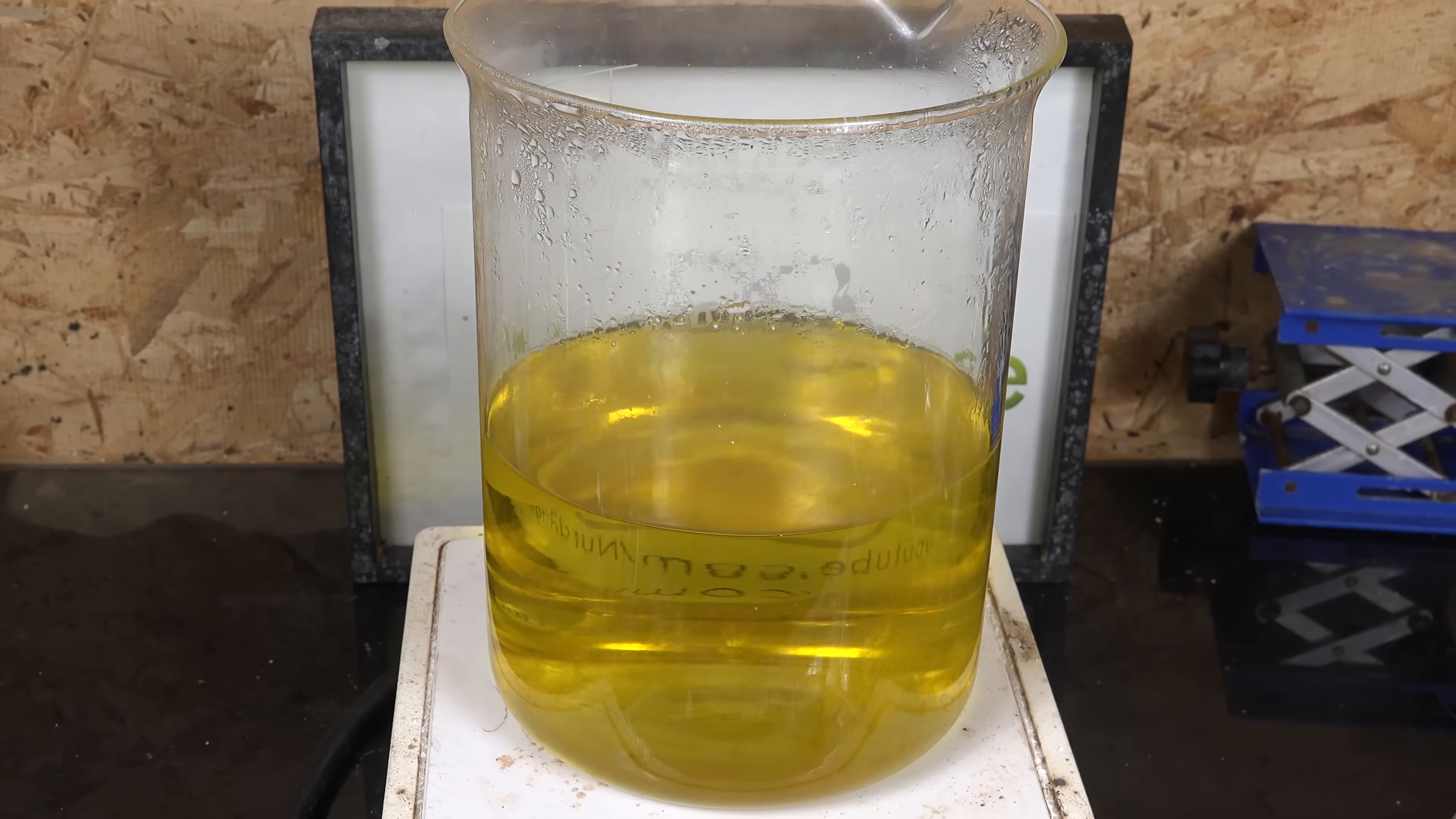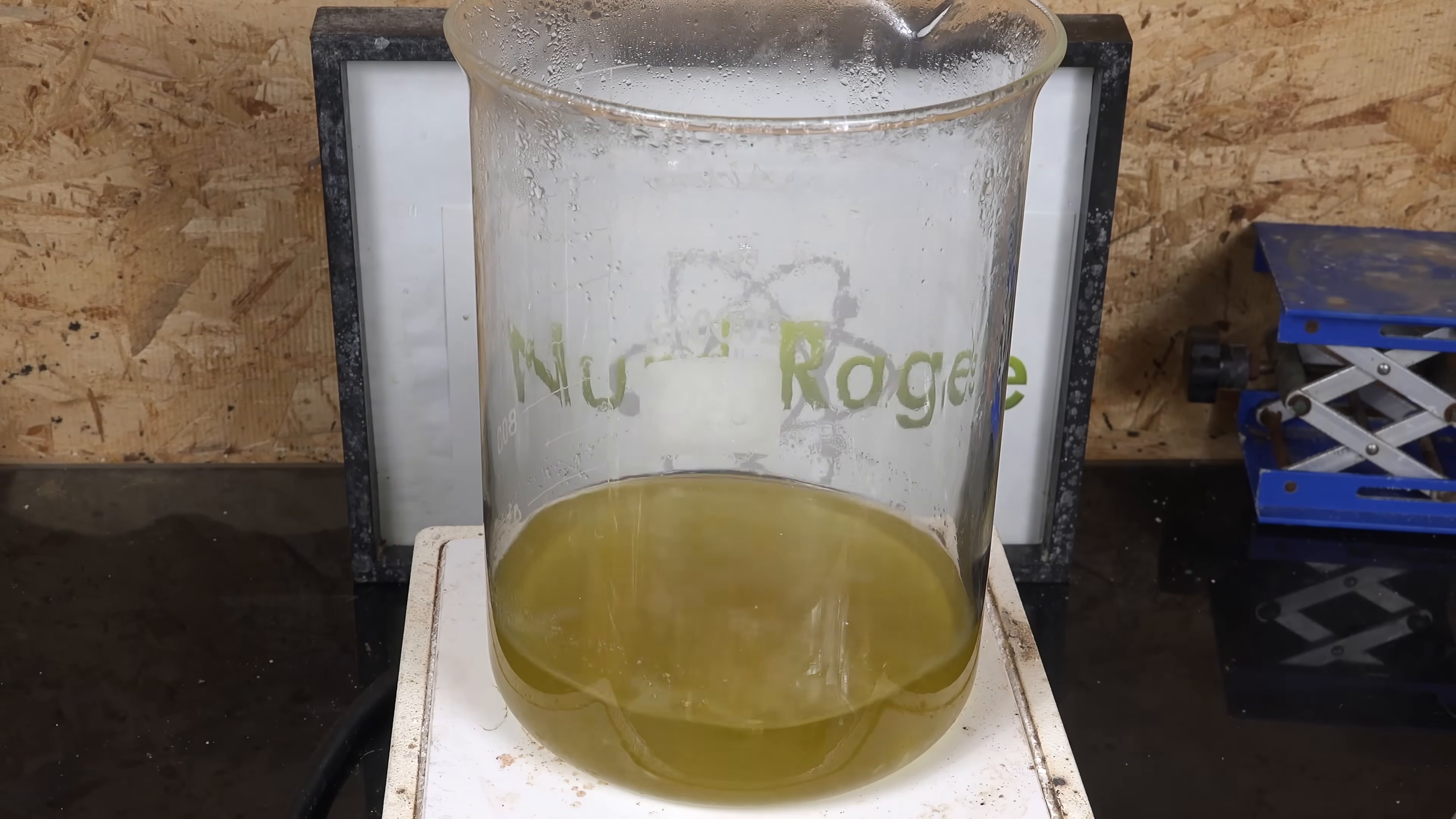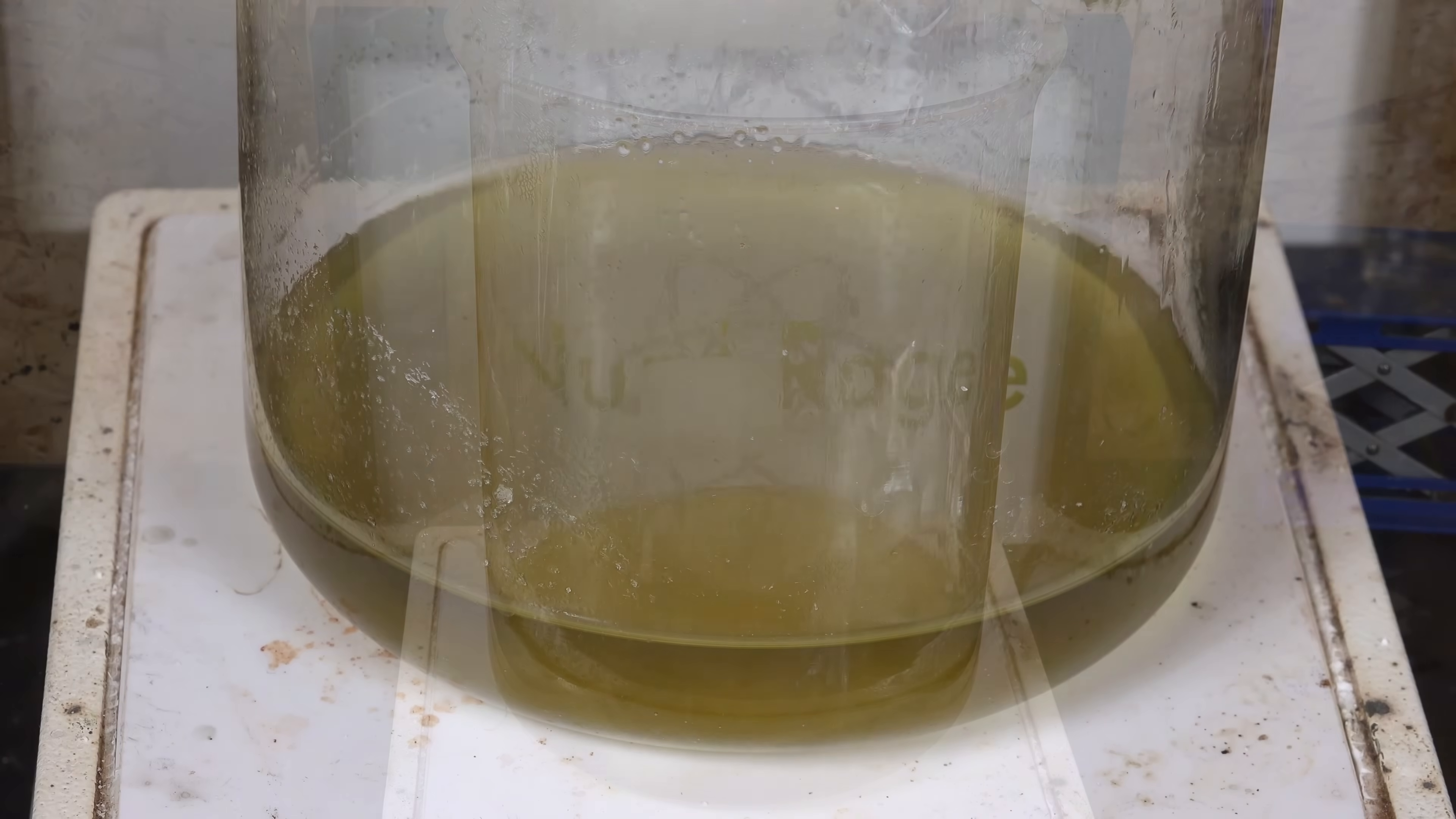Meanwhile, our sulfuric acid is in the filtrate and I boiled it down until it started to crystallize. For my solution, this was around 200mL. Then we let it cool.